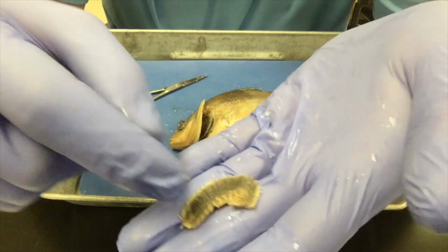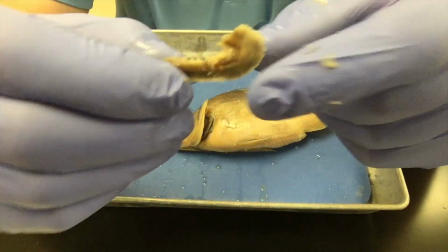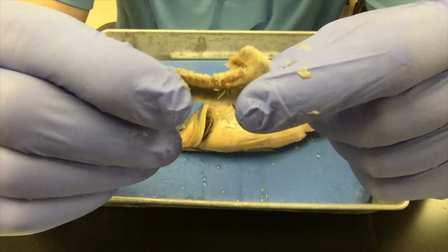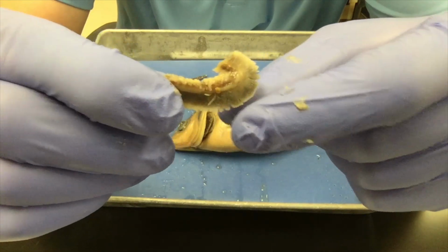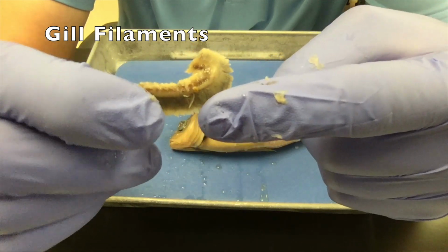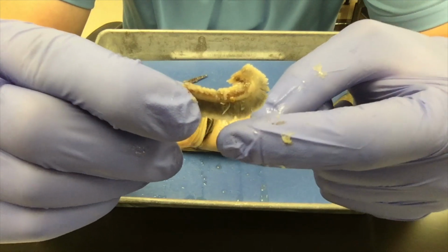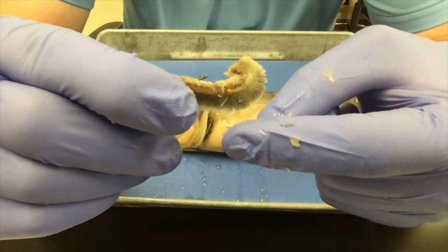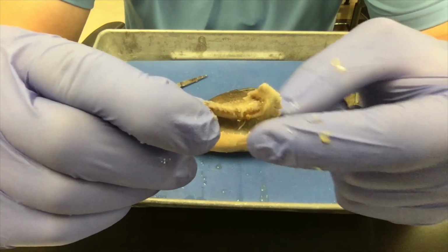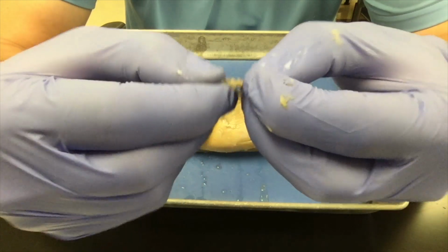Here is a gill. In the middle of the gill, the supporting structure is called the gill arch. Coming off of the arch are lots of little feathery structures called the filaments. In life, these would be red because they'd be full of blood. They are the structures that are actually pulling the oxygen out of the water and then getting rid of the carbon dioxide. They're facilitating the gas exchange. That's why there's so many of them, to increase the surface area.